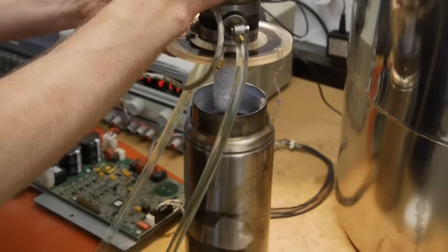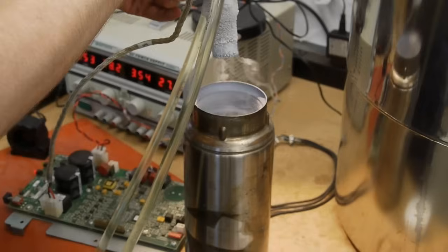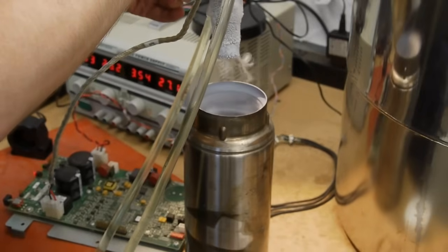Okay it's been about an hour and so I lifted the cryo cooler out of the dewar and you can see before the tip has time to warm up there's still liquid air dripping off the tip and falling down into the dewar which is pretty cool.